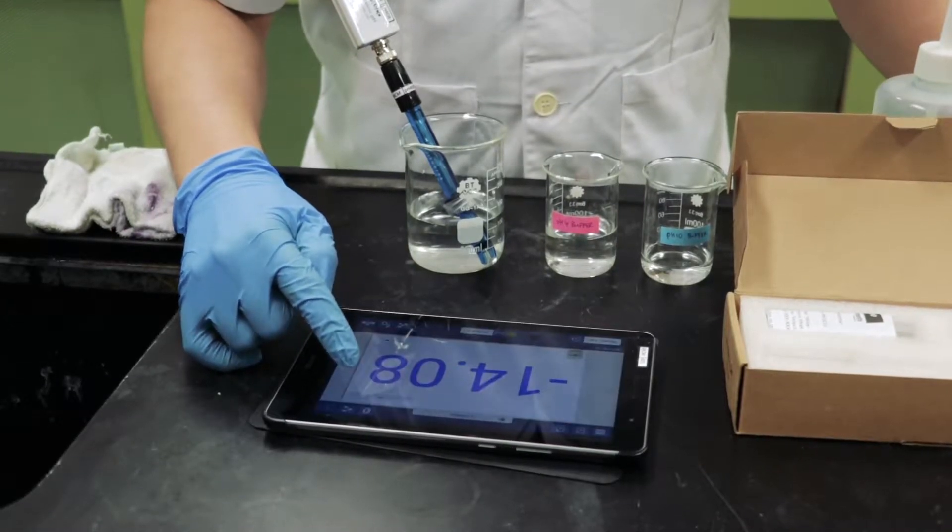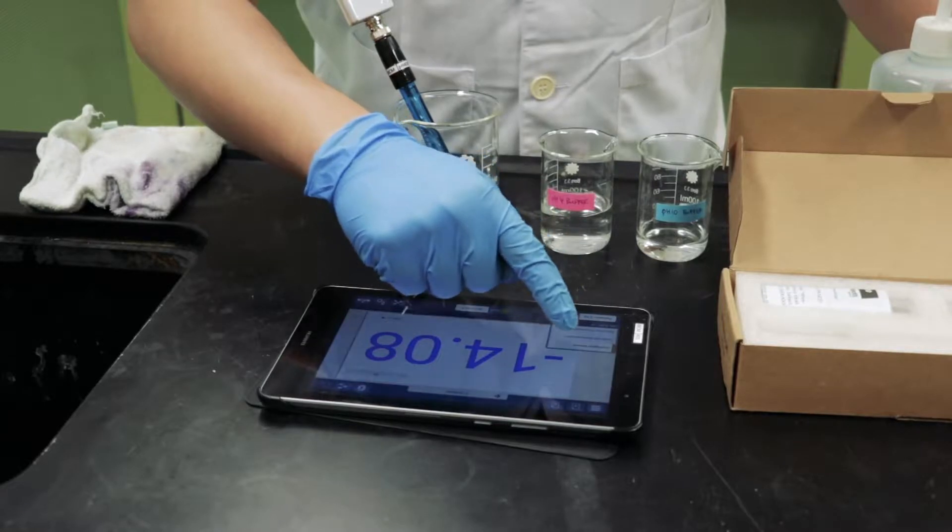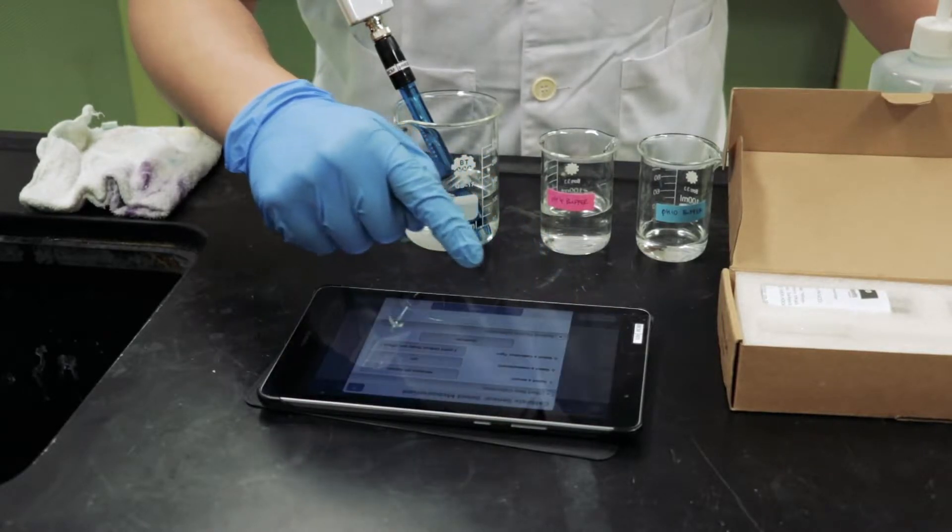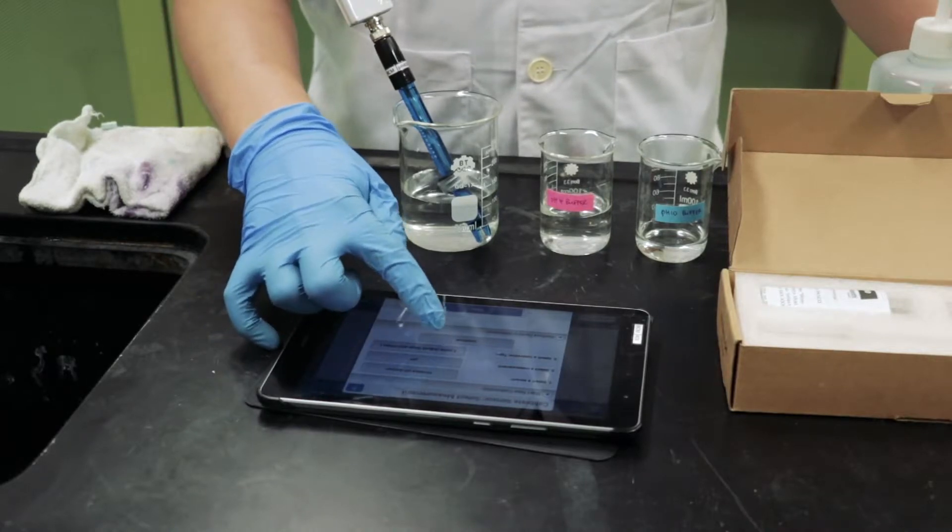On the bottom left-hand corner of the screen, select the pull-up bar and choose Calibrate Measurement. Make sure the calibration type is set to 2 points, adjust Slope and Offset and press Continue.